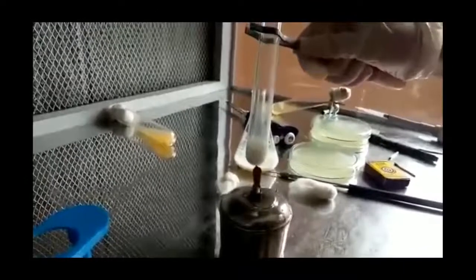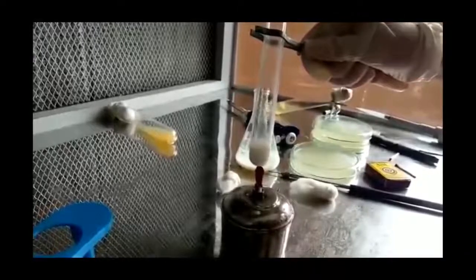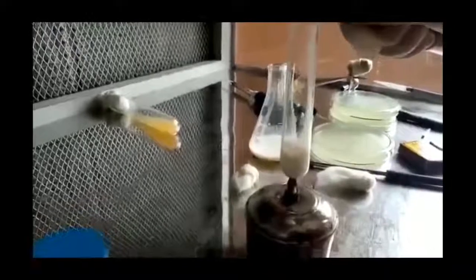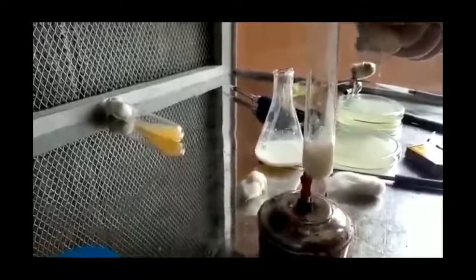As we finish measuring the samples of milk, next we need to heat. The heating of milk may be done by using a Bunsen burner or a spirit lamp. Another method that may be used for this incubation of the milk is by keeping them in a boiling water bath. We allow a little boil to happen in that milk sample. After the boiling is over, we let it cool for some time.